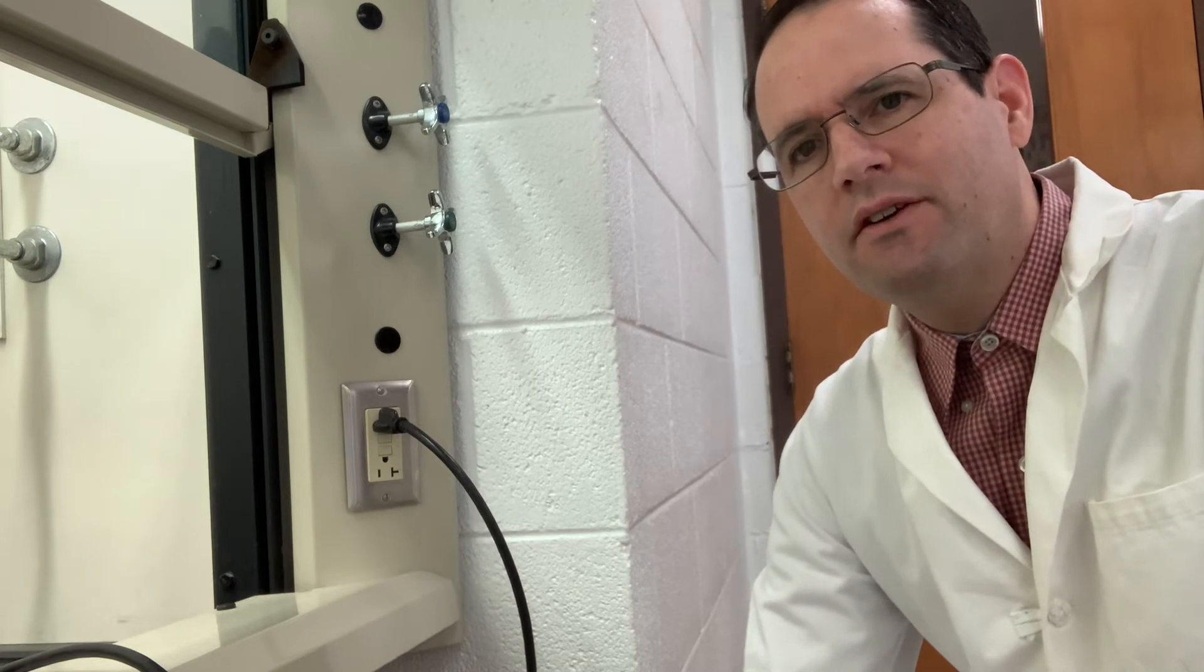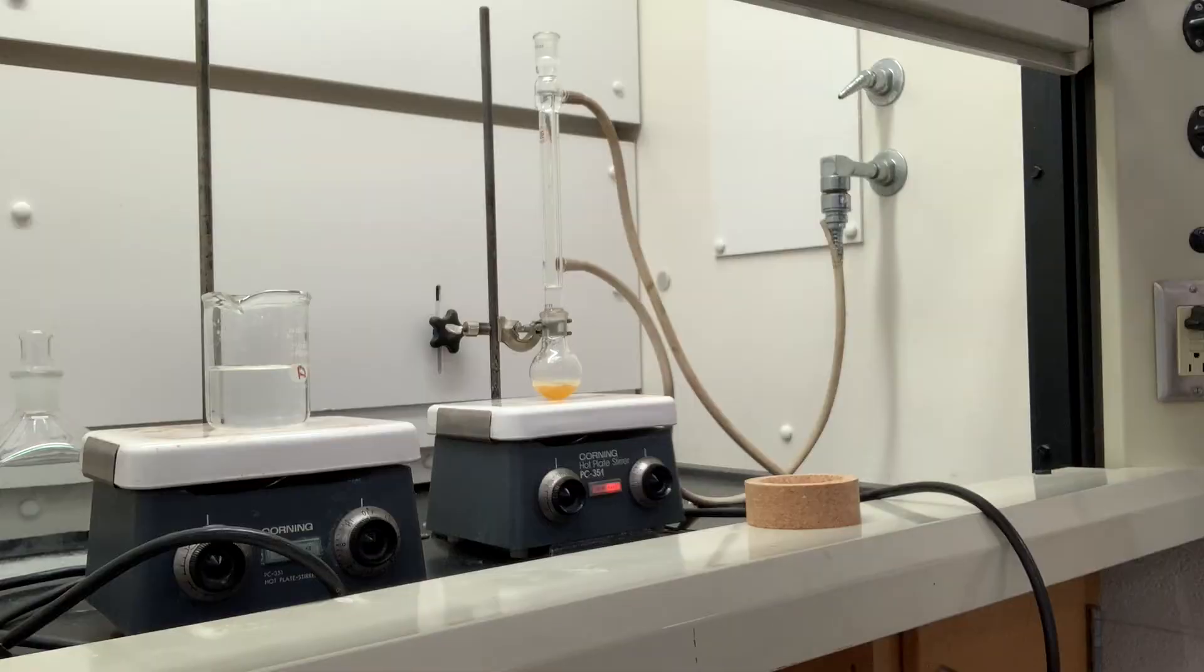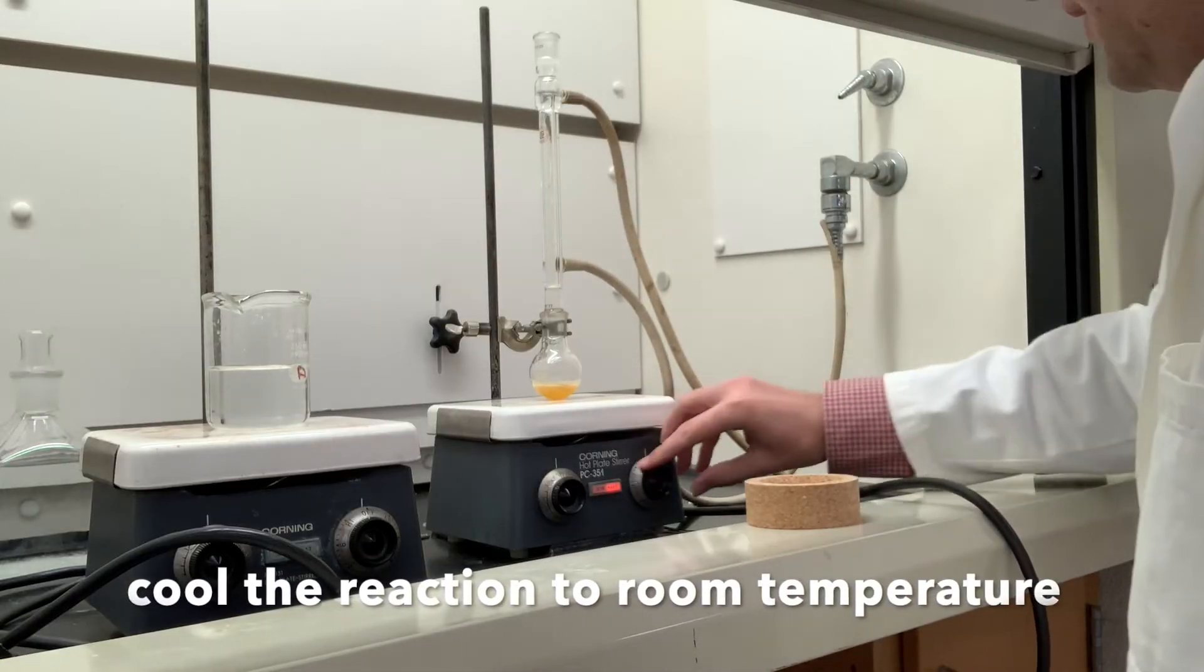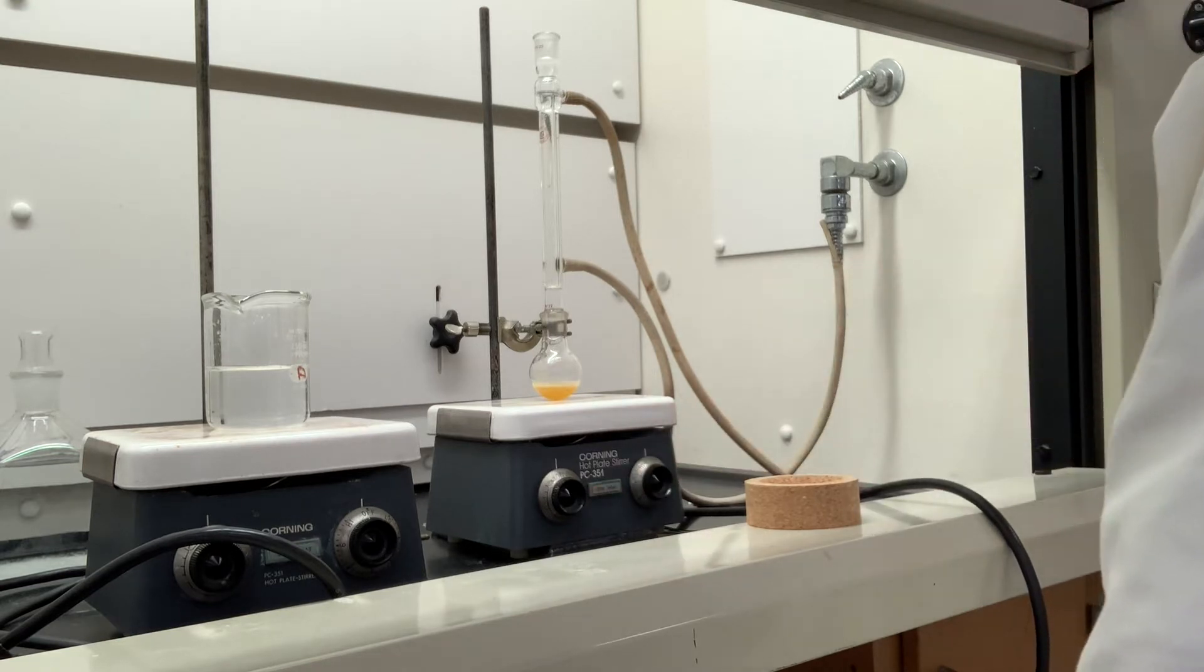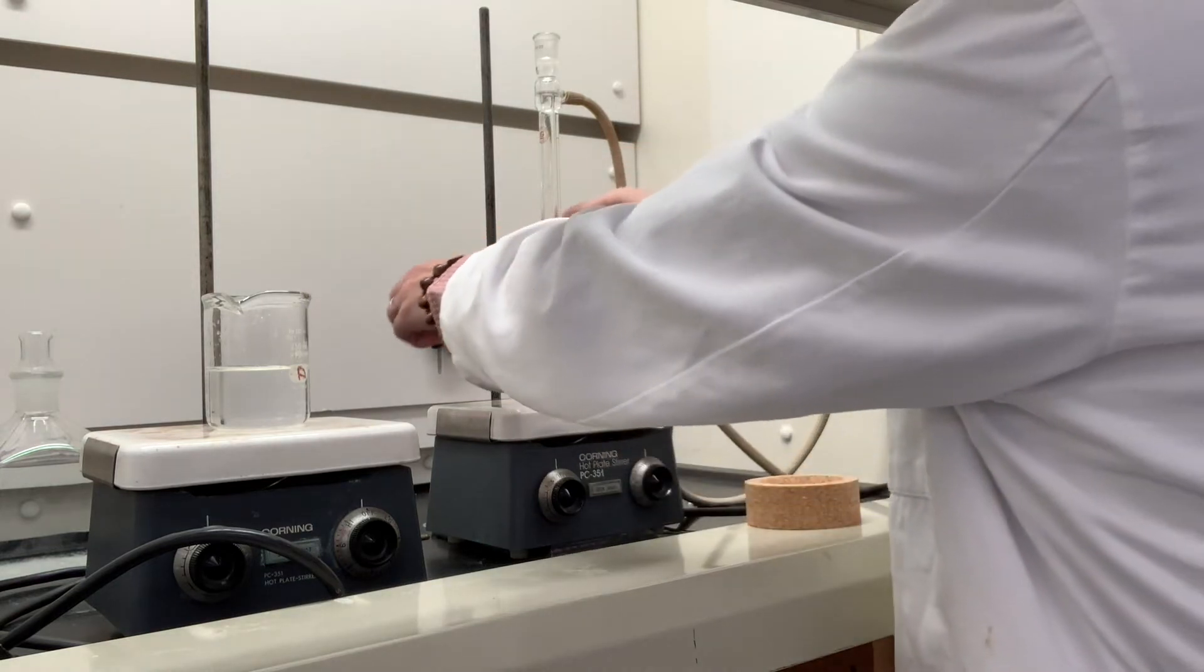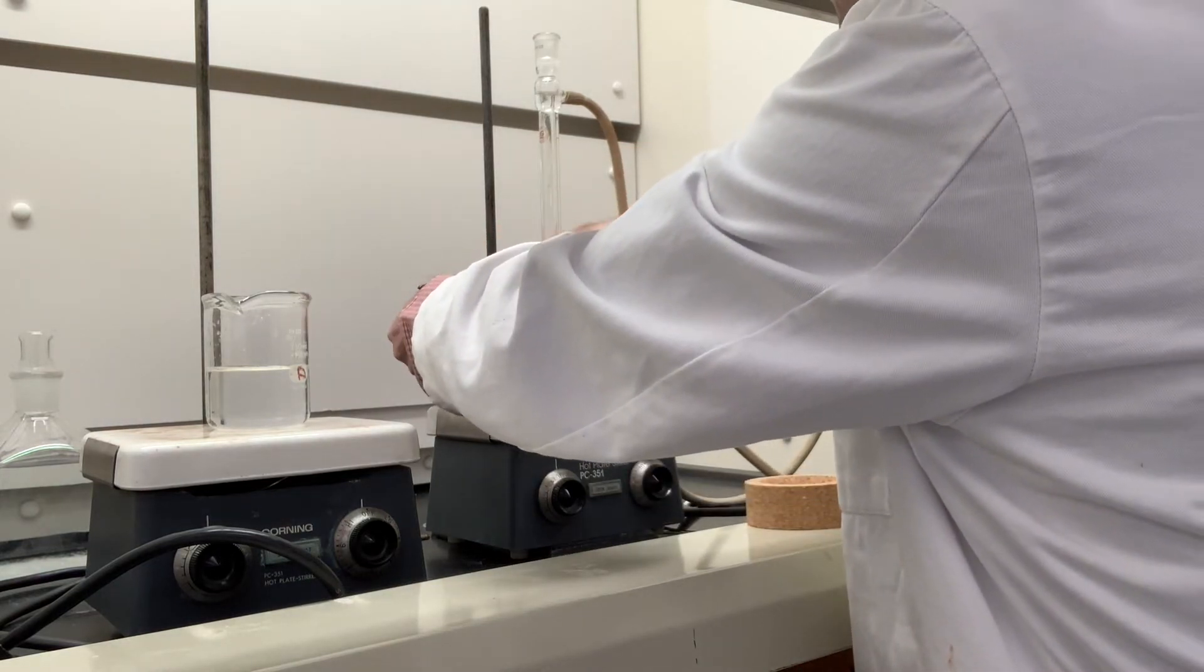This reaction's been an hour. You can see nothing really has changed with the color or texture and so on. We'll stop the heater and turn off the water and raise this up.